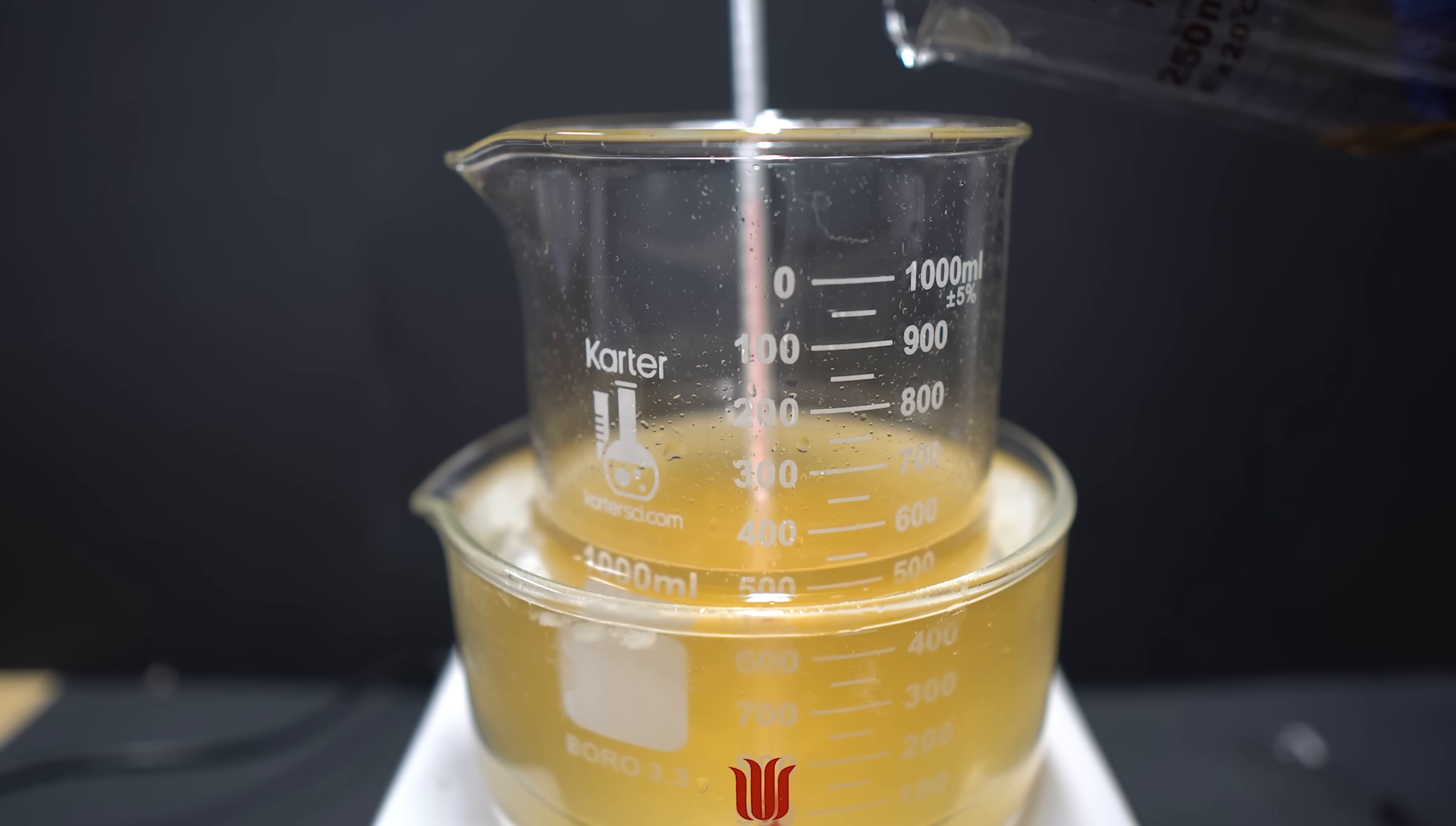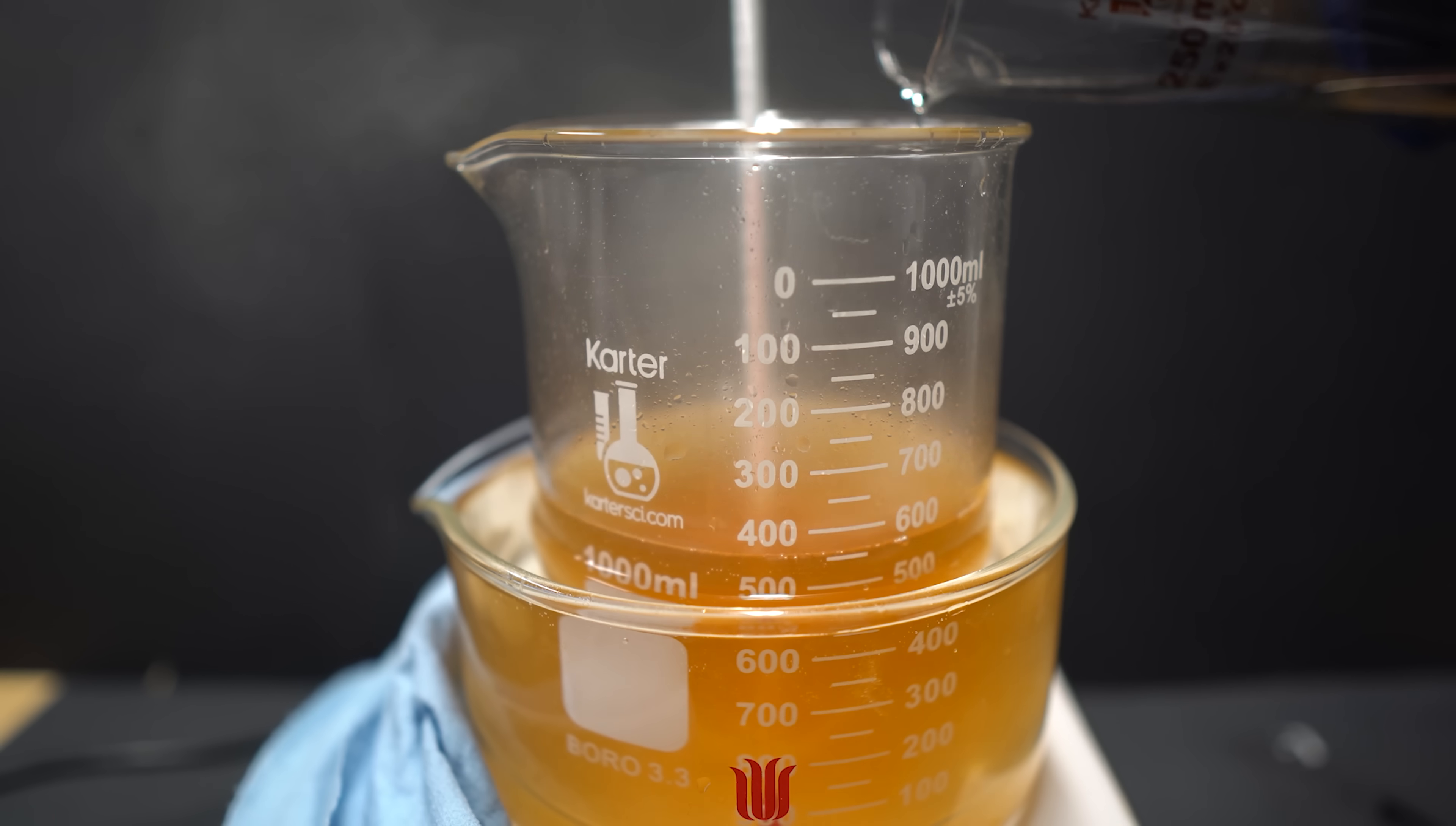Now, theirs might have slightly changed to a very light orange color. However, mine just kept getting darker, and it was kind of worrying me. And the messed up part was that I was actually drinking orange crush soda earlier, and this looked exactly like it. Mine also fumed quite profusely, but it really wasn't that big of a deal, as I was in a very well-ventilated area, and it'd probably be a good idea to do this outside.